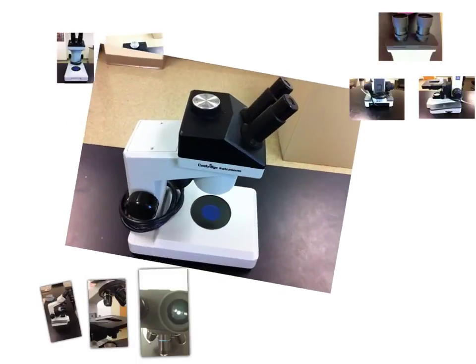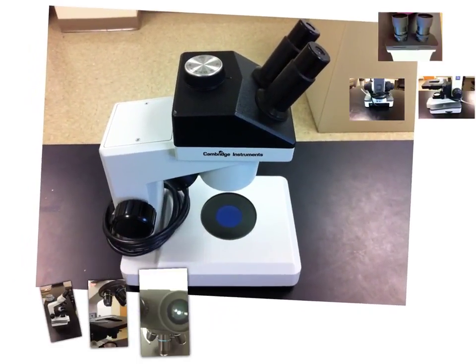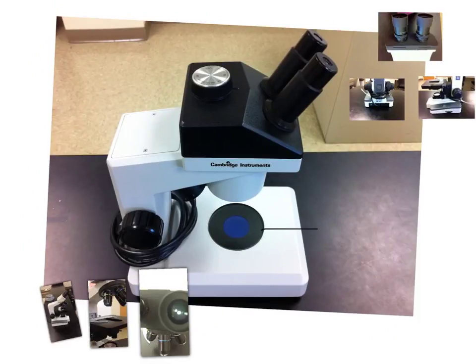I'll bring that to the beginning. So here's our Dissecting Scope. What you normally would do is you would put your specimen under here. We're going to unwrap the cord that is normally wrapped around the base and plug that in.